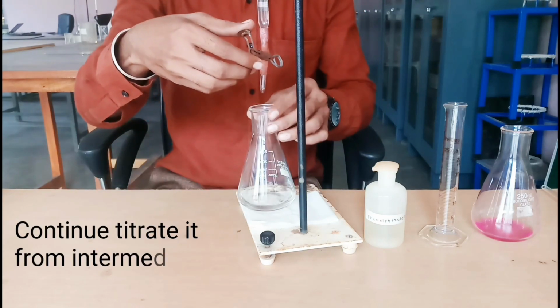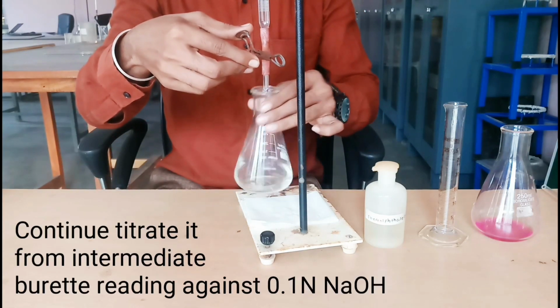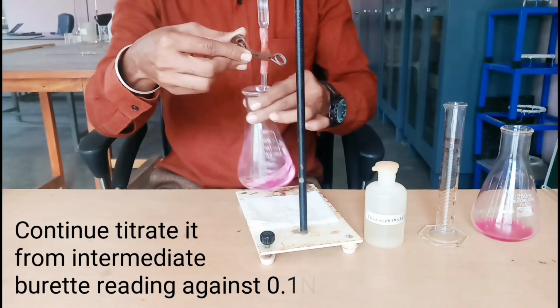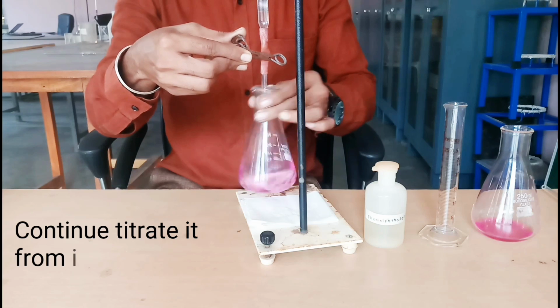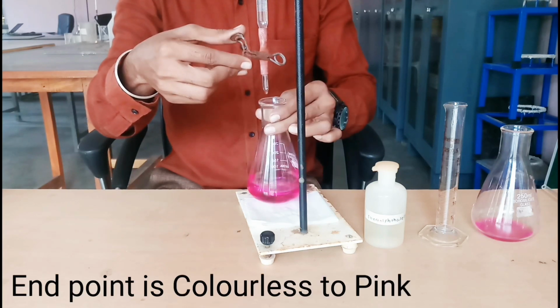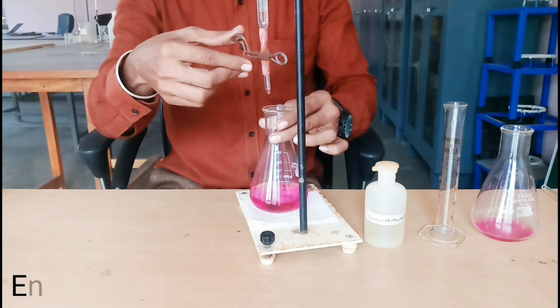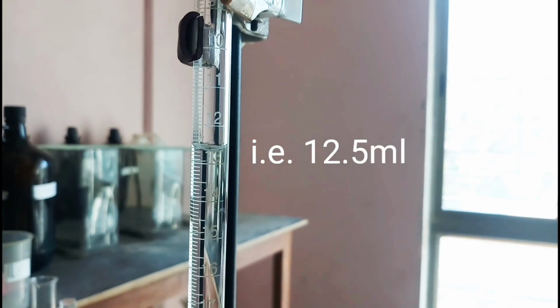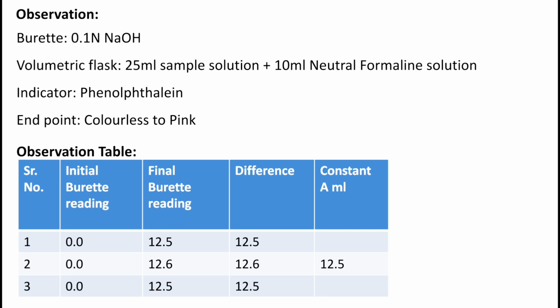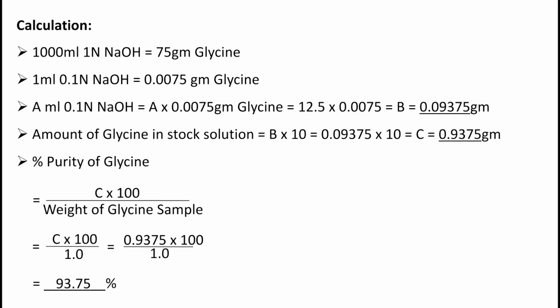Continue to titrate it from intermediate burette reading against 0.1 normal NaOH. Endpoint is colorless to pink. That is 12.5 ml. Now see the observation and observation table. The burette reading is 12.5 ml. Finally, do the calculation of percentage purity of glycine as shown.